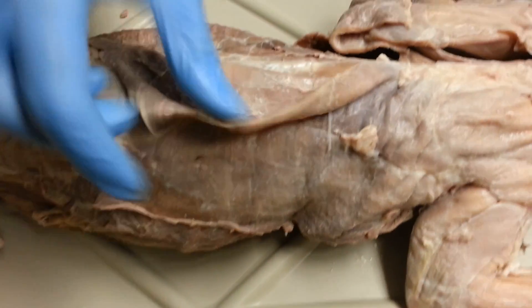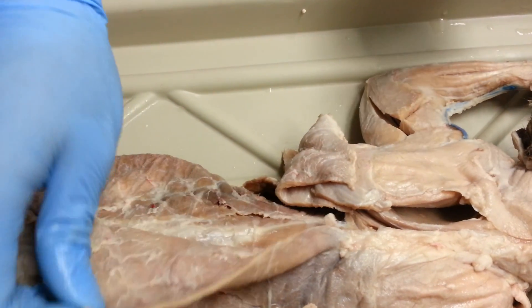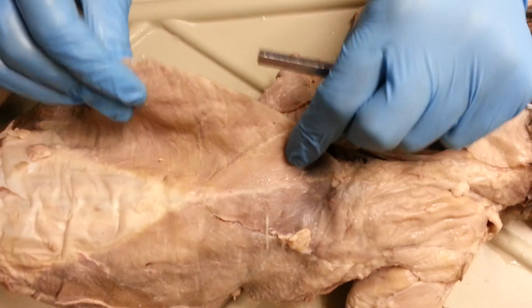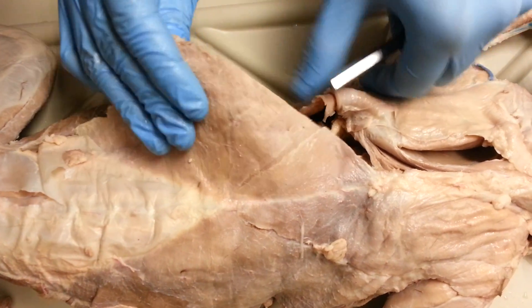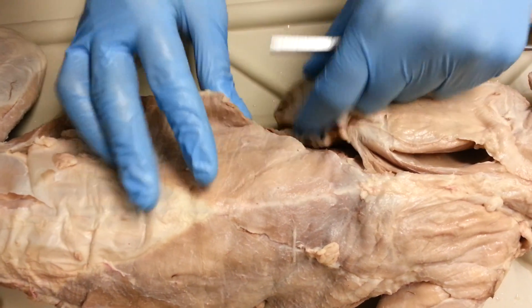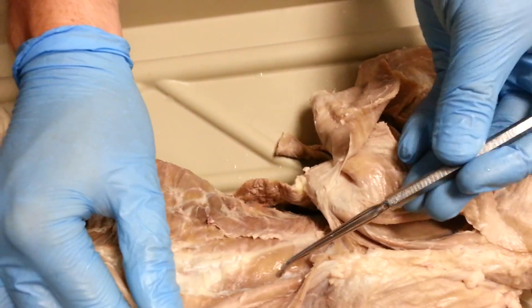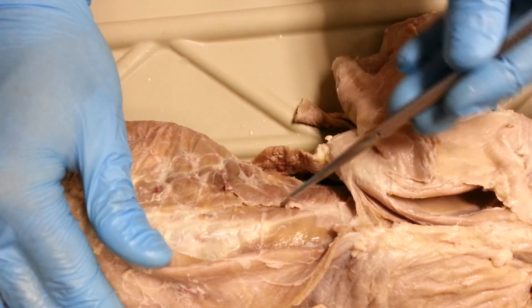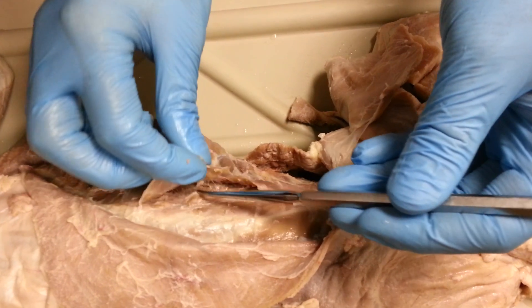Let's go to the upper body — since we've just done all of the lower body, pretty simple, right? That's only about five minutes. Here we have our latissimus dorsi. Moving it aside, we have our spinalis dorsi here, our longissimus here.